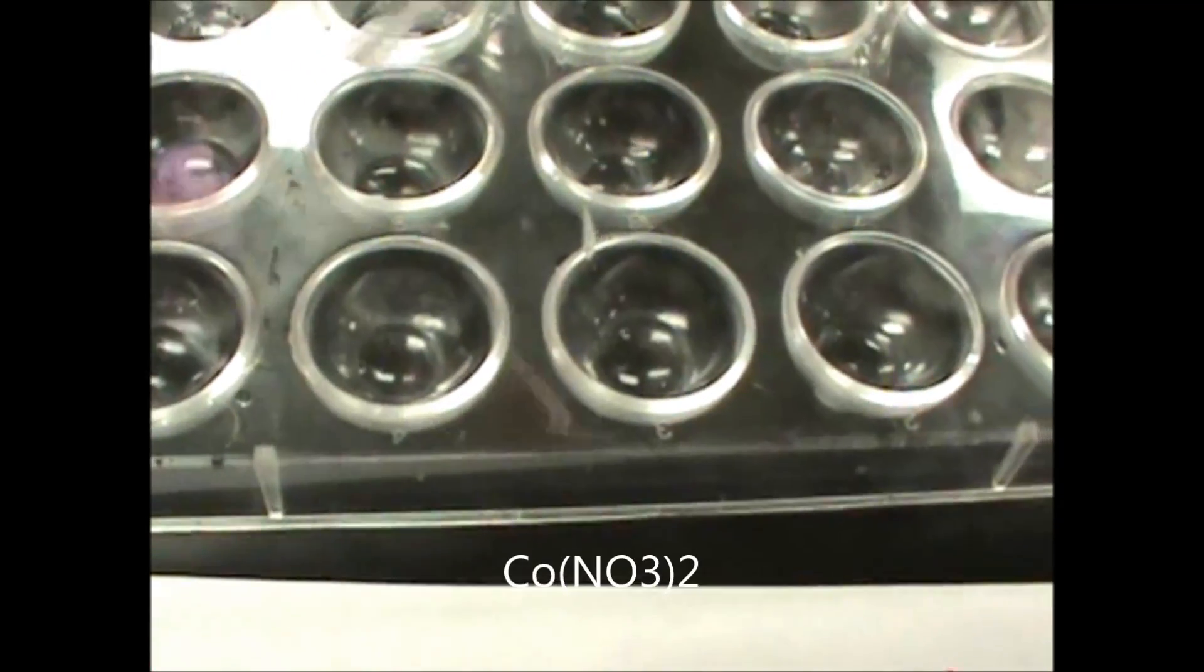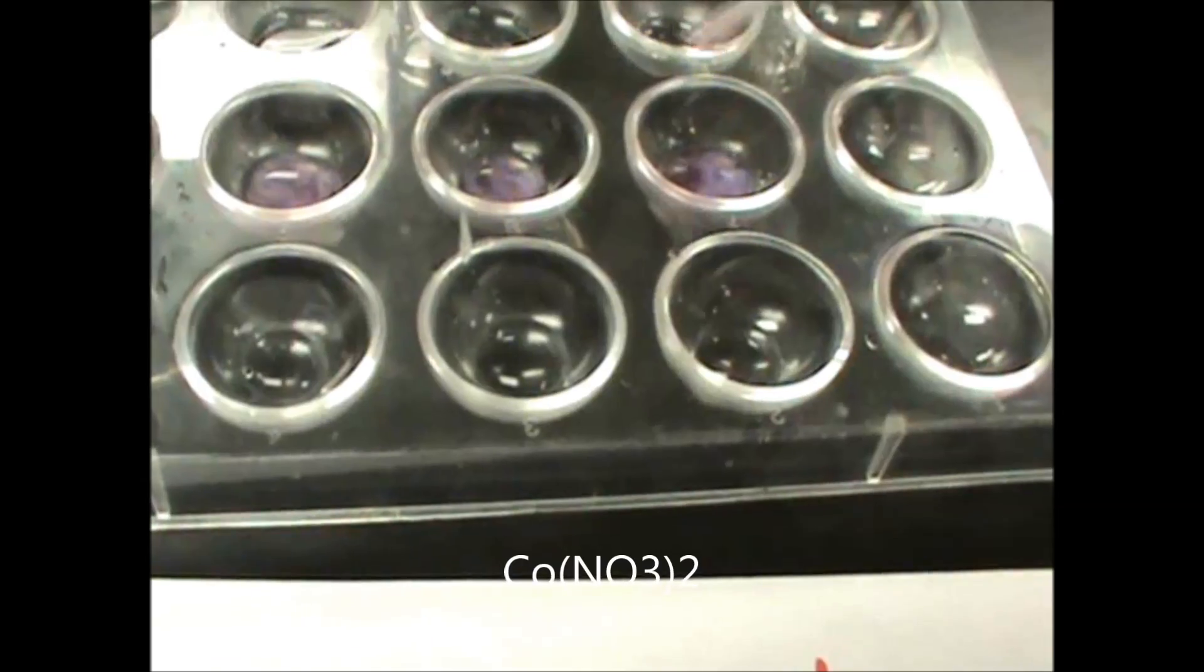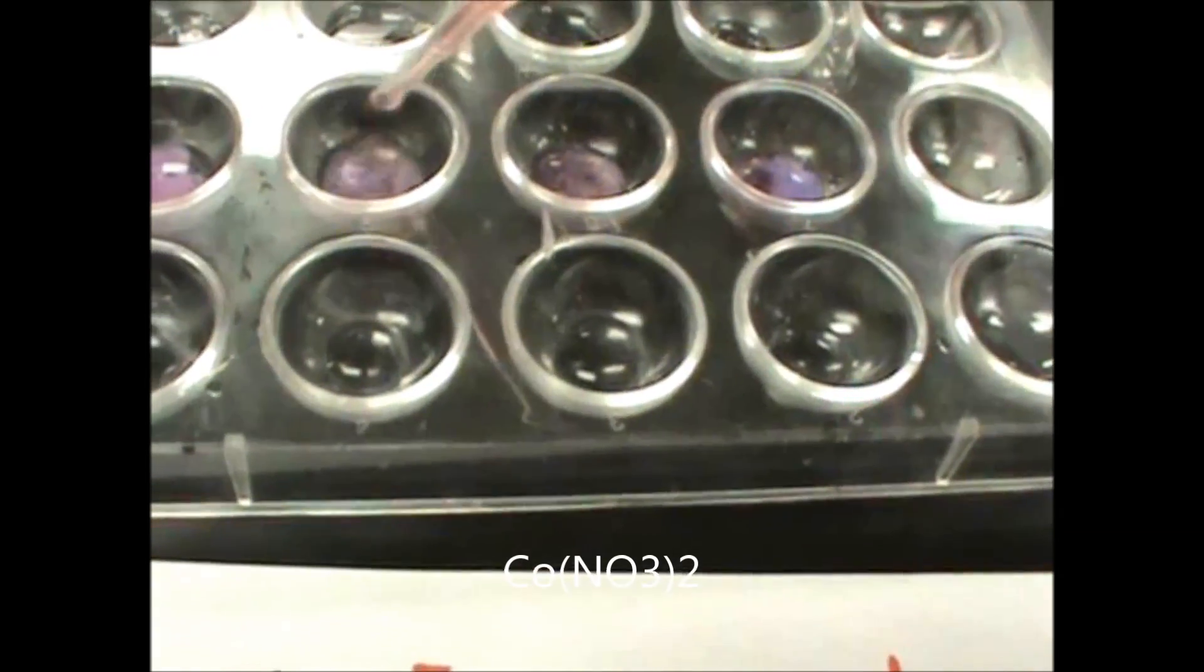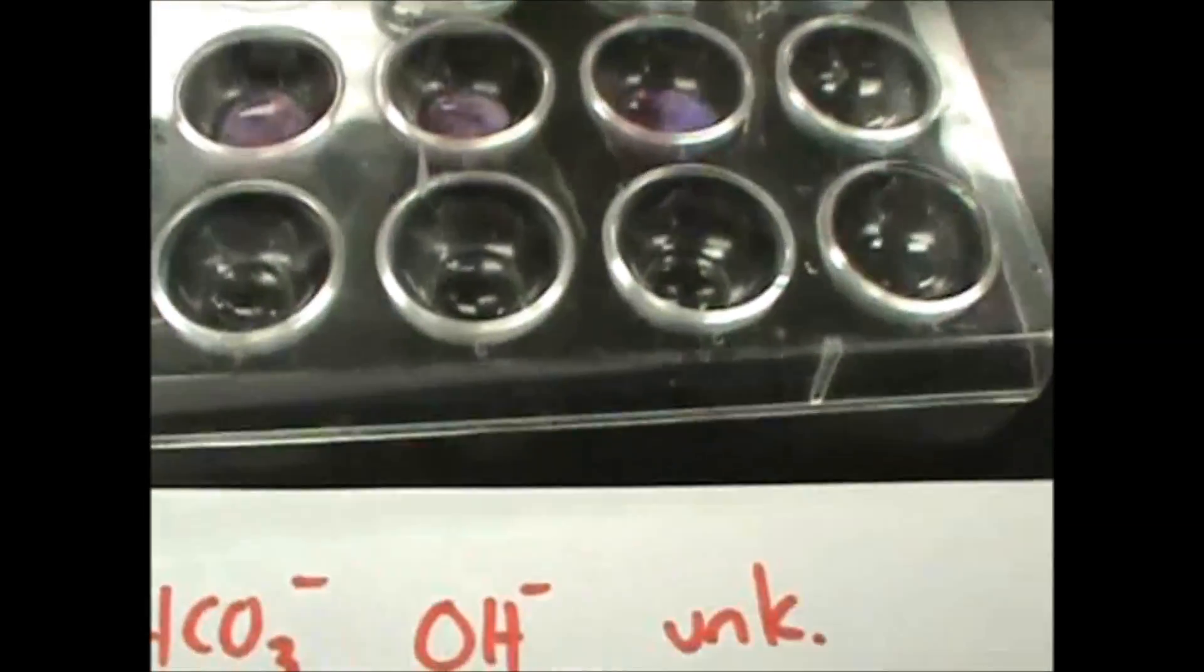Next you're going to add cobalt nitrate to all three and look at the different precipitates to see which one you match the most. This is a challenging one to do because a lot of them look very similar, although you can see here that I'm definitely different with my unknown than the other ones.